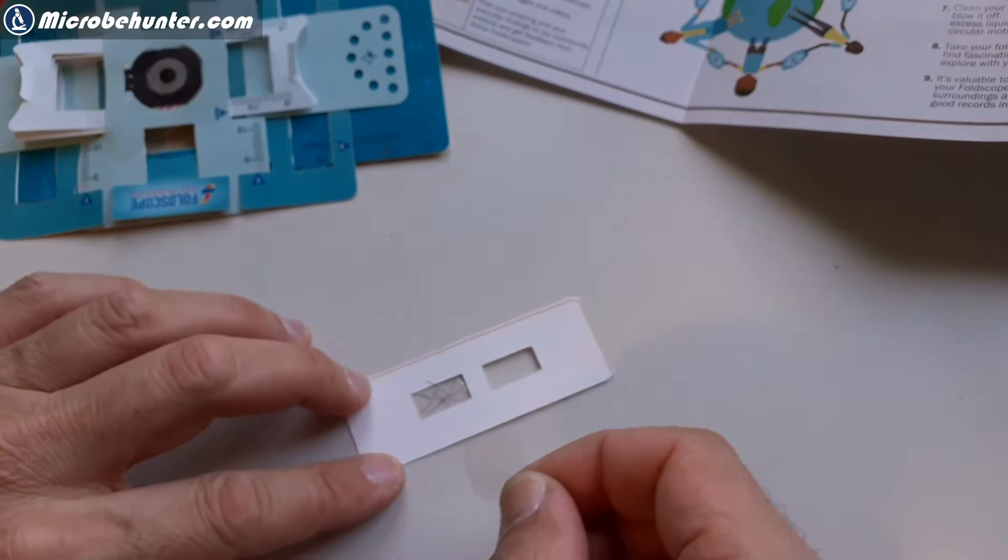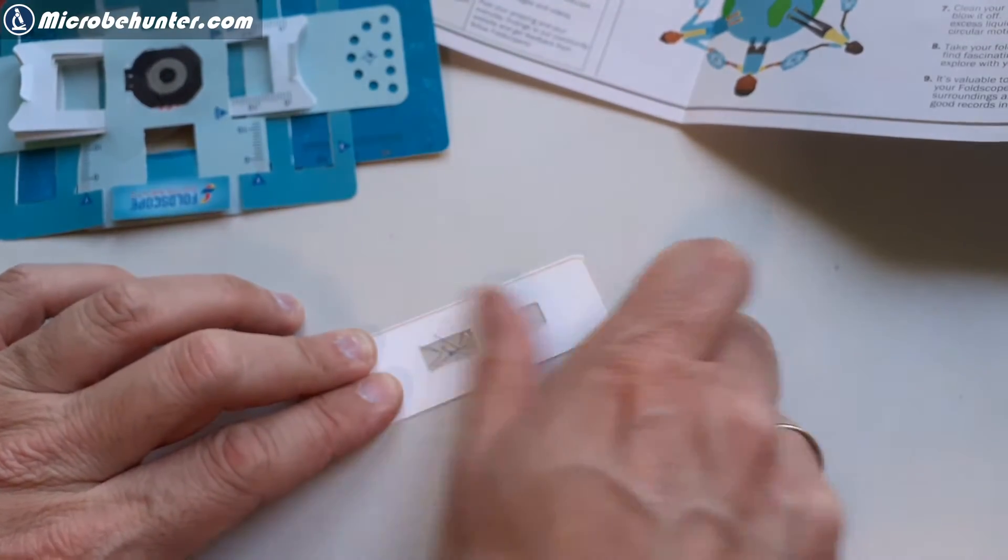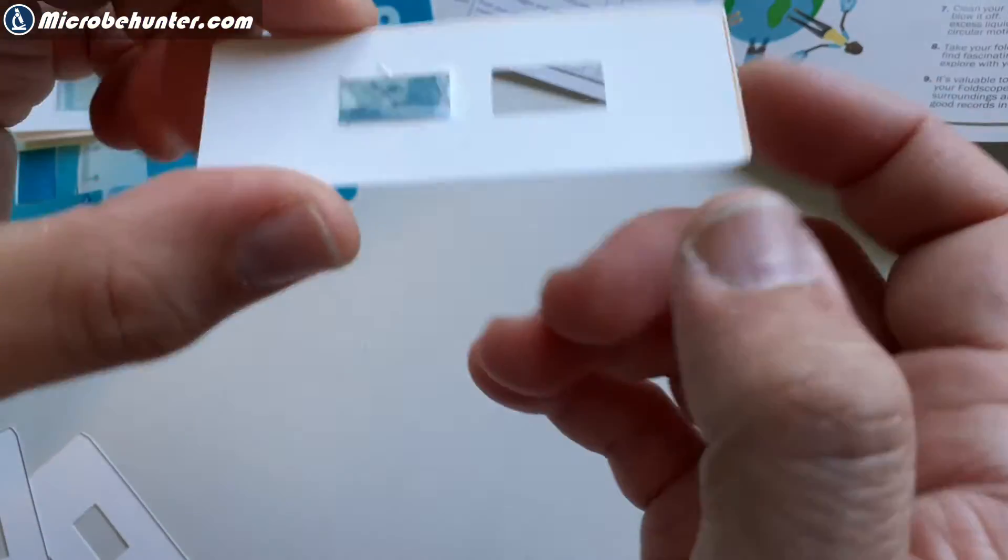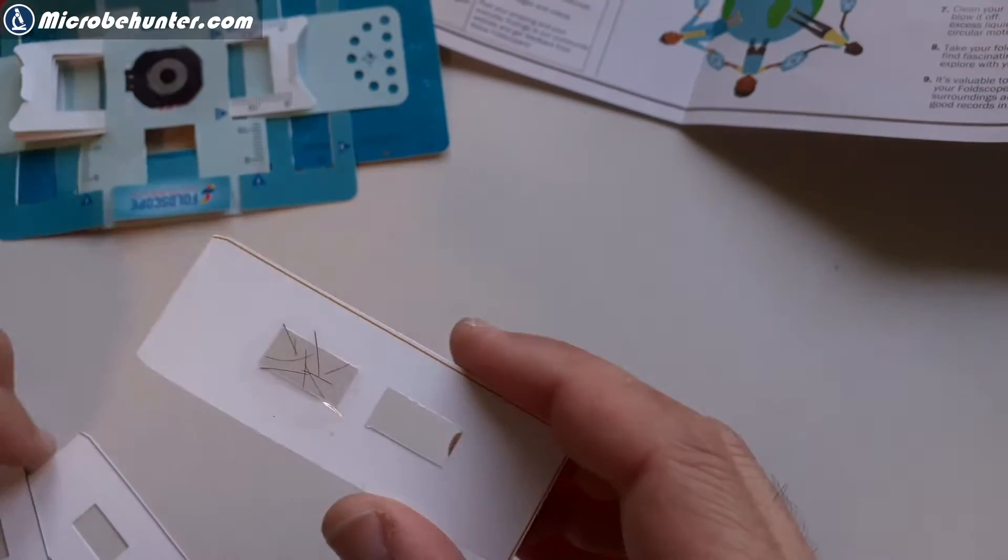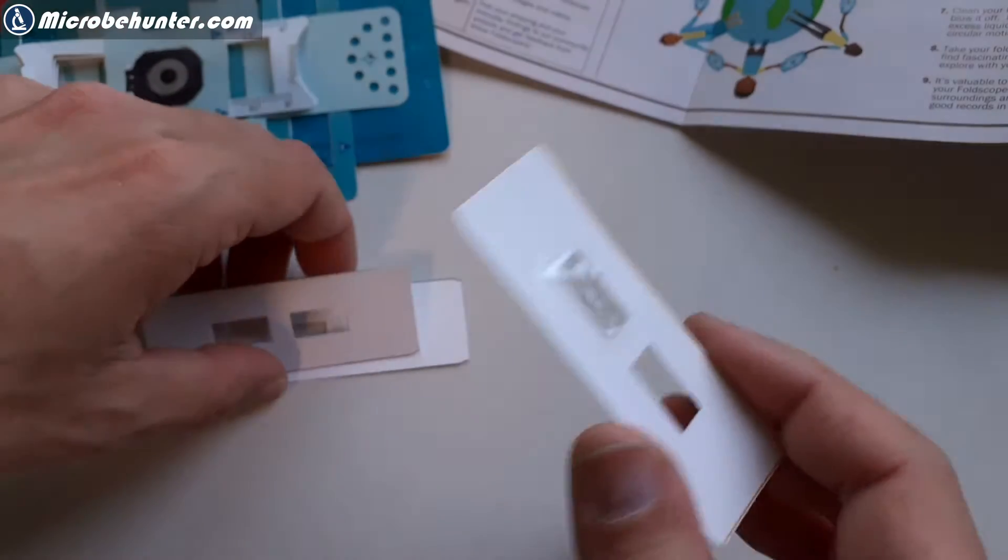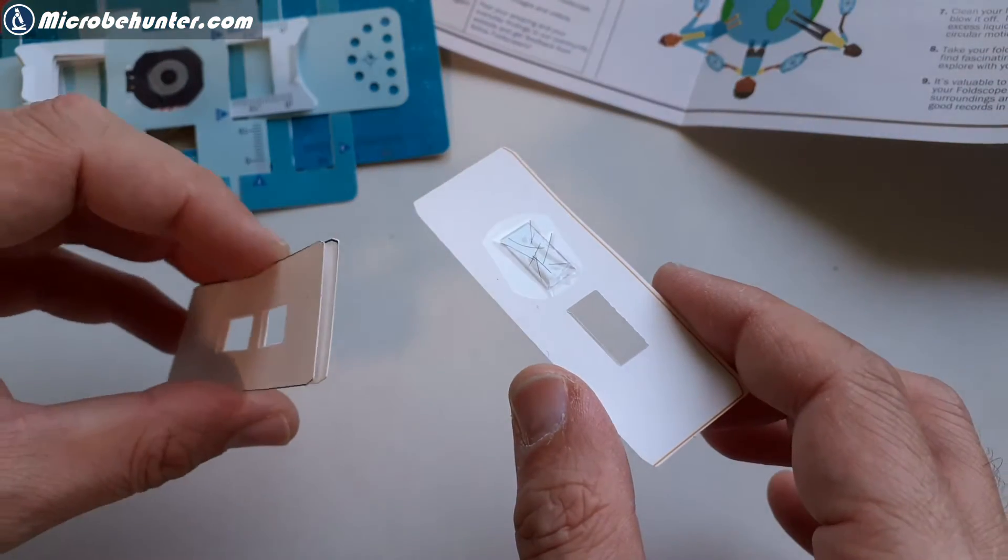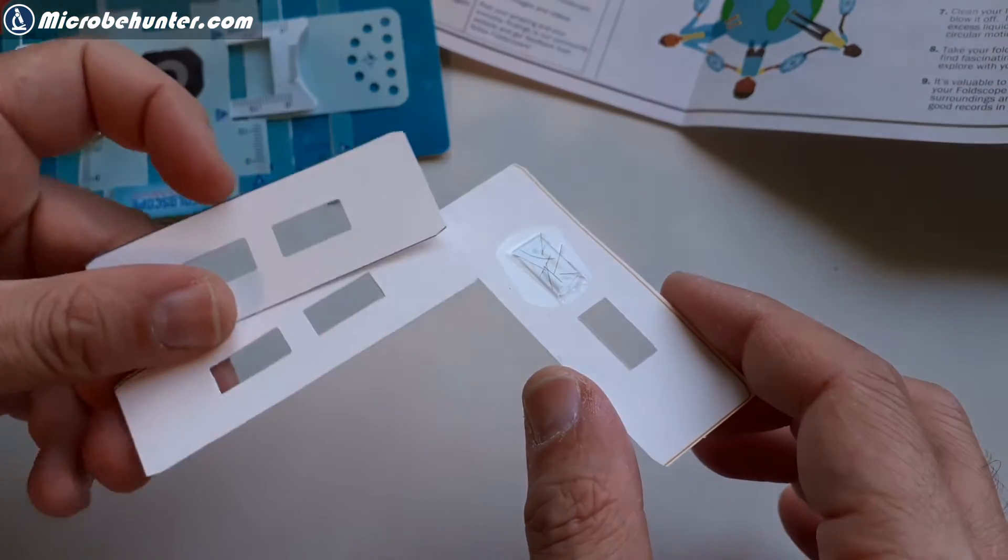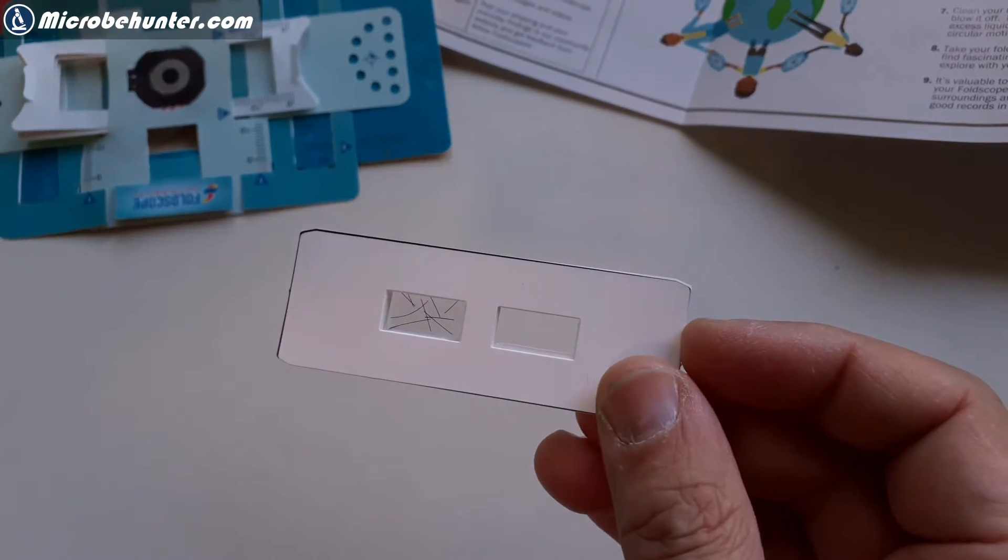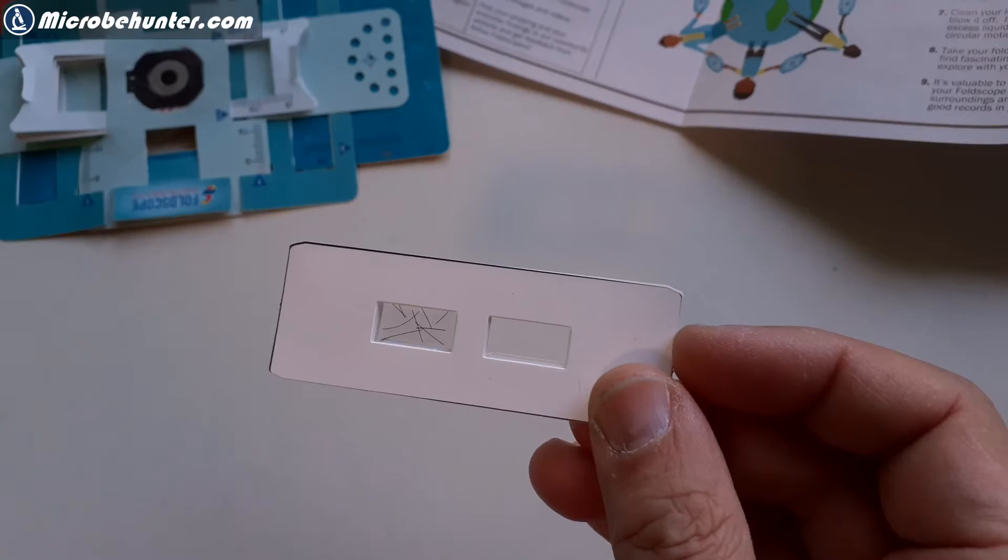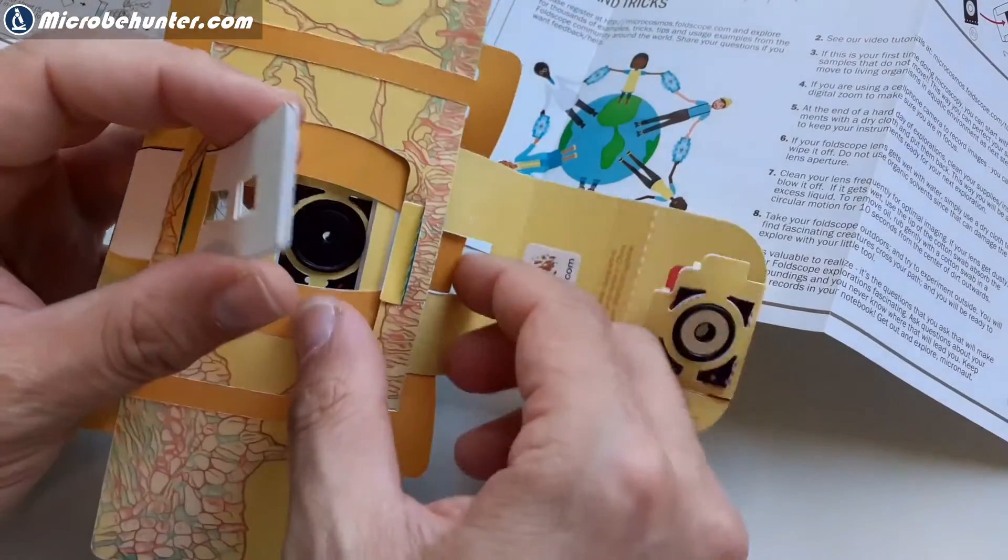Okay, now the specimen slide, there is some tape supplied. The specimen slide has to be made like this. So now I did it is to form it. I put some hair in it. And there is this tape on both sides. Okay. And this is then the thing that has to go into the microscope. And you have to also include a spacer on the top on one side. Not on top and bottom, but it says you have to include it on one side. And then the whole thing is inserted.